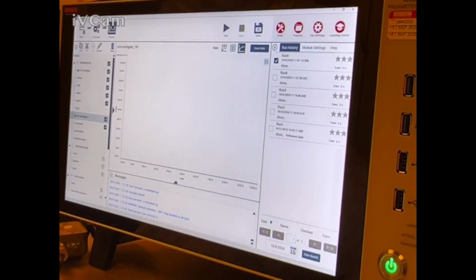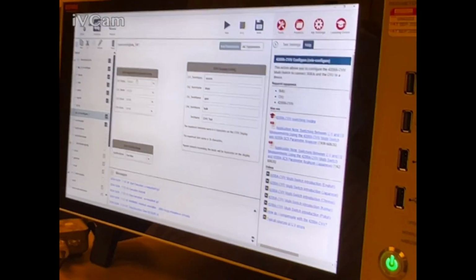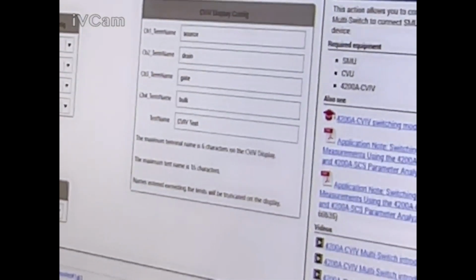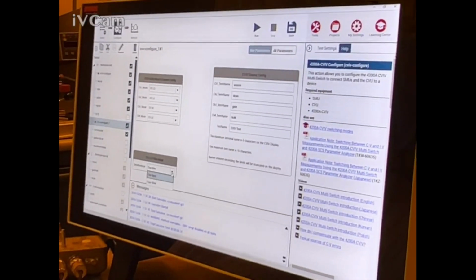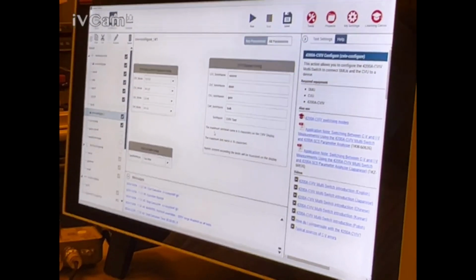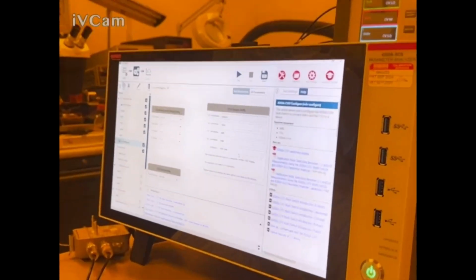I think I did that right. Gate, drain. Let's see. CV low, CV low. Okay. Channel 3 is the gate, which we all have. Why isn't this working? 2-wire or 4-wire. This should work. 4 is the bulk.